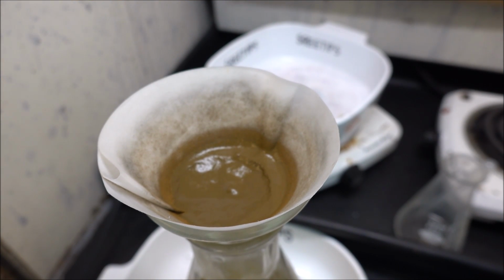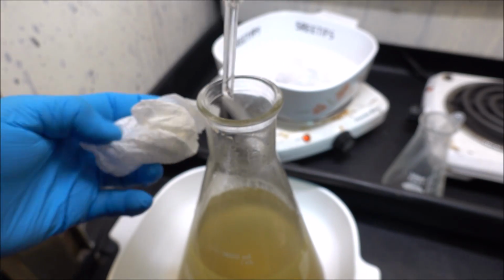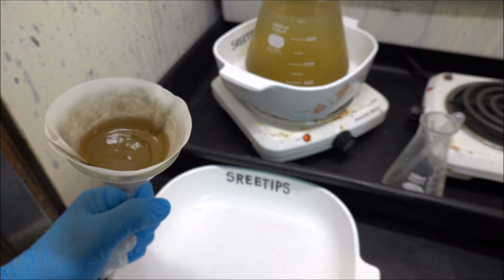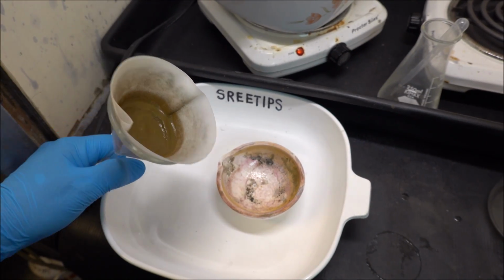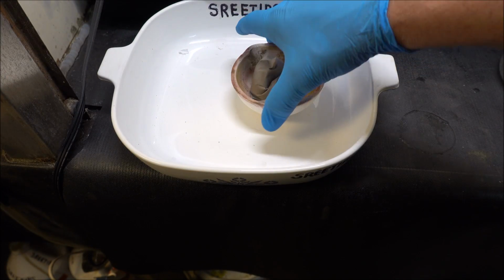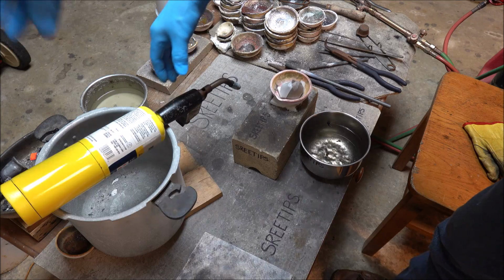I've rinsed the gold with some hydrochloric acid and then distilled water. And now what we're going to do, we're going to get it out of this funnel here and into a melt dish. Get it over on the melt table and get this thing melted, get it out of our hair, get it over with. Alright, let's get it over here on the melt table. We'll melt this up into a bar and then get it ready to ship off to the refiner.